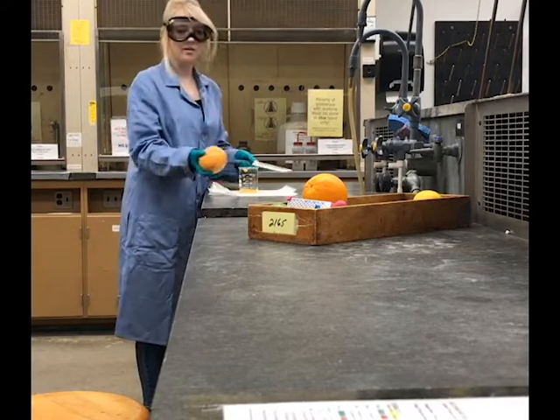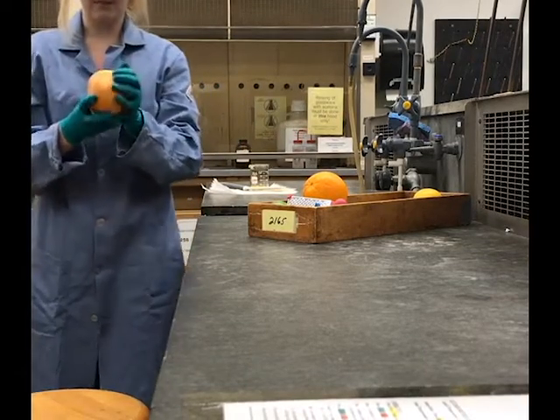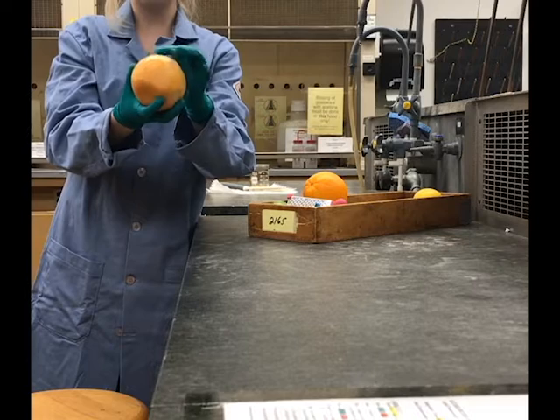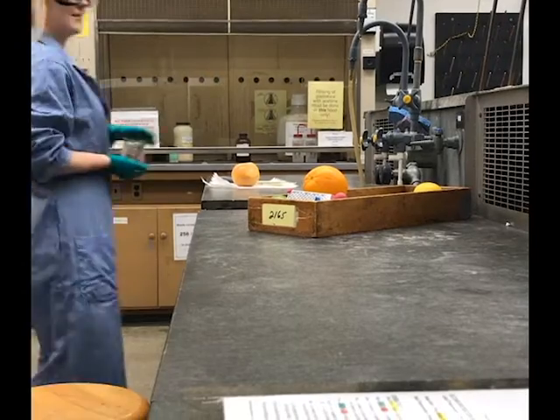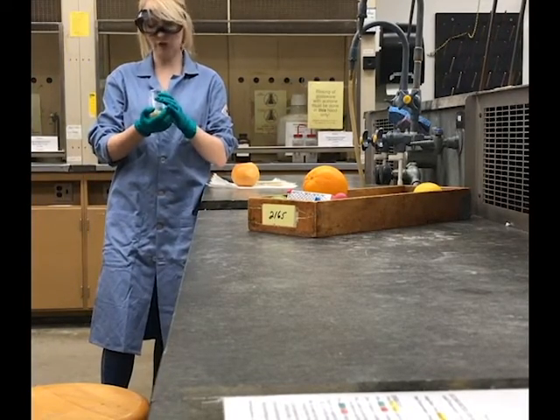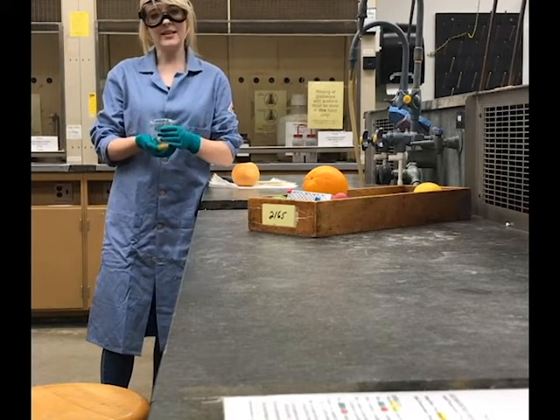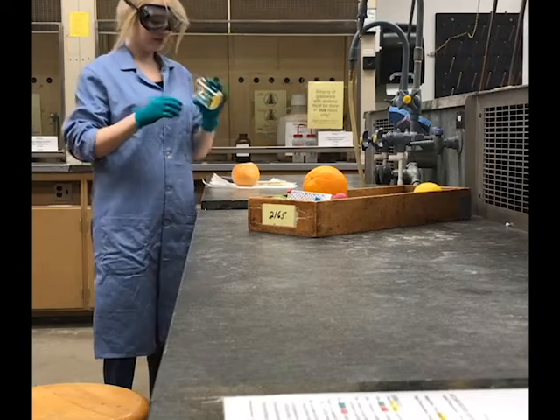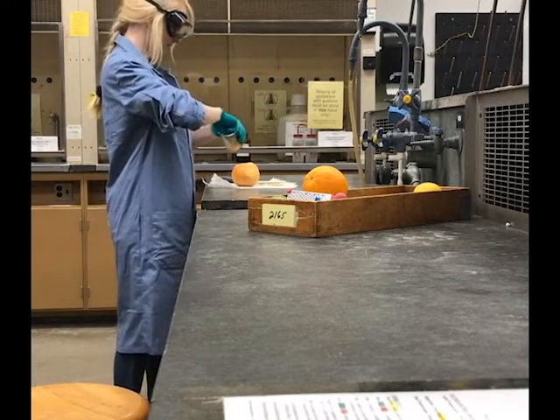All right, that looks like it's about 1 gram. The important thing is that I've only taken the outer surface or the rind. She will be right back after weighing the rind. So it turns out that I have grossly overestimated what 1 gram is. Instead, I have grated 4 grams. So I'm going to remove approximately 3/4 of this zest.